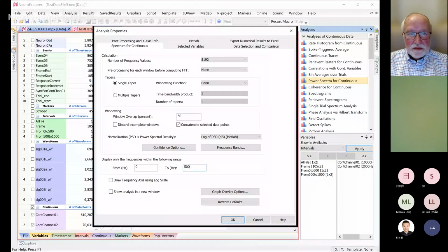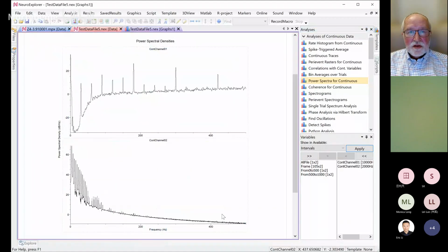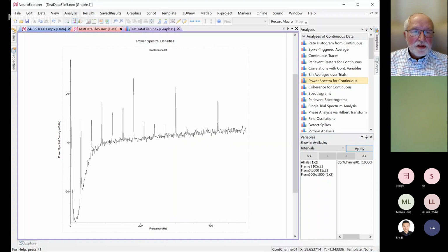Sorry, Alex, this step is to remove 50 hertz, right? Yes, so I'll just show you. Okay. So I have the data that has lots of frequencies. So this is 50 hertz. So no, it's 30 hertz, 60, etc. I just showed you the example. So let's look at the power spectral density. So this particular variable is really heavily contaminated, for example, with this 180 hertz noise, right?